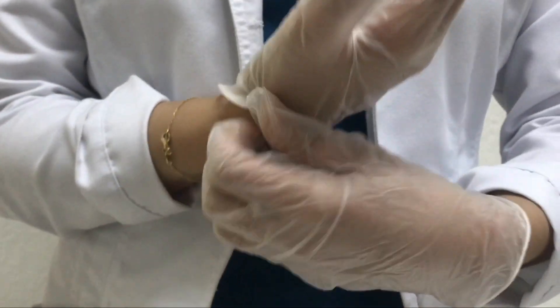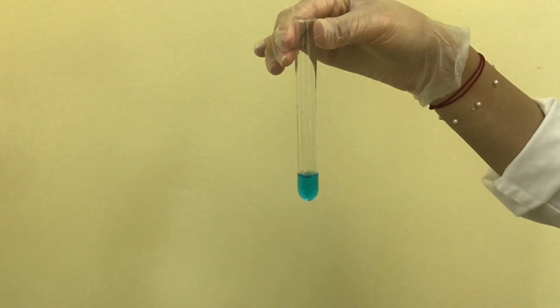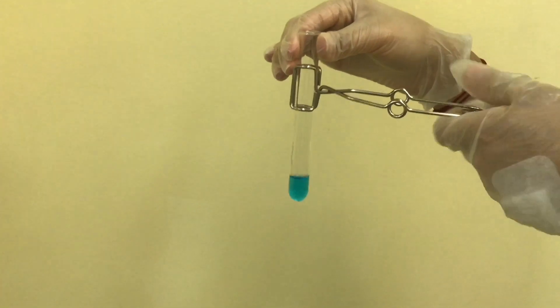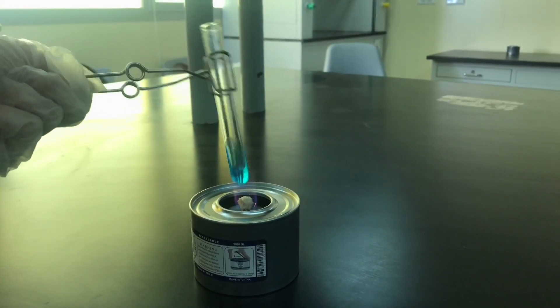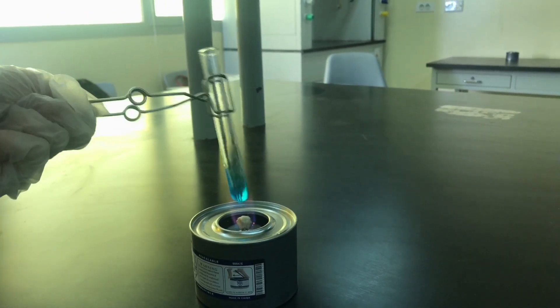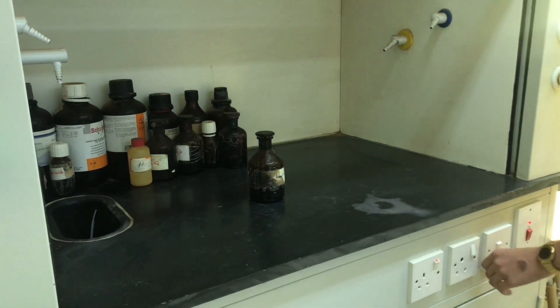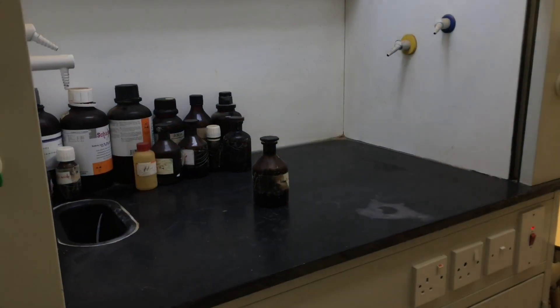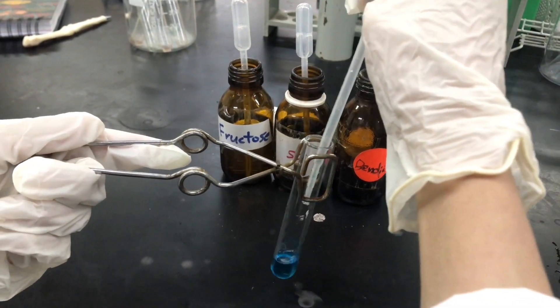Please remember to wear your lab coat as well as your gloves. If the experiment includes heating, hold the test tube with a clamp from the edge to prevent it from falling. While heating, point the test tube to the wall, window, or anywhere far from yourself and anyone in the lab. Remember to handle acids in the hood and be really cautious. Use a pipette for each solution and never interchange.